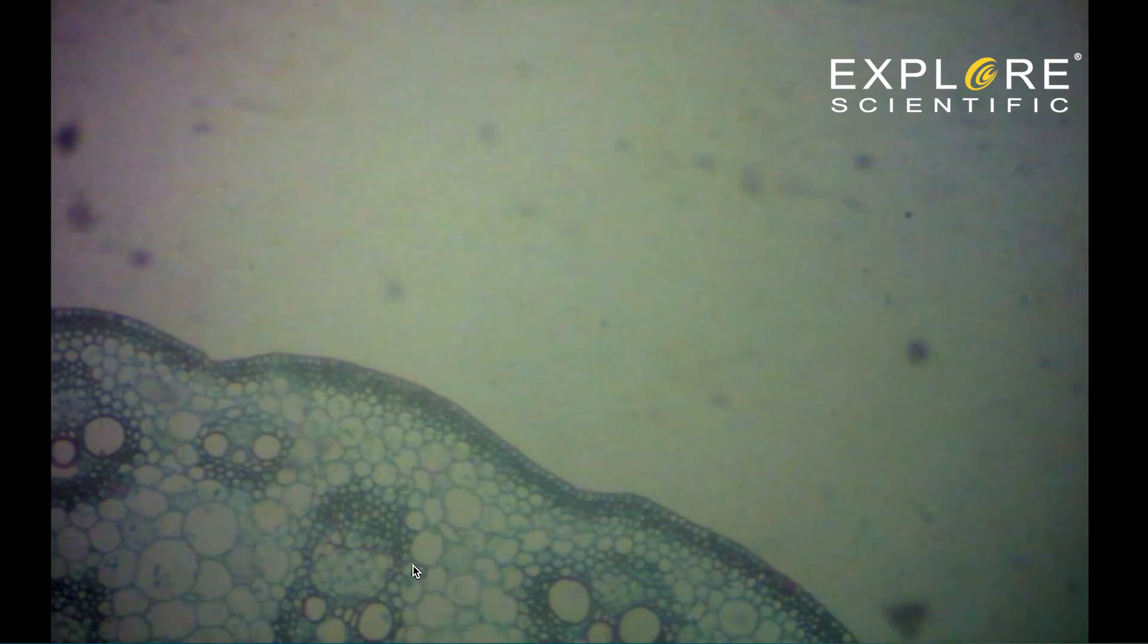When you start to see the color, slow down. Watch carefully for the edge of the specimen to appear. Keep turning until it comes into focus. If you continue to turn the focus knobs, it will go out of focus.